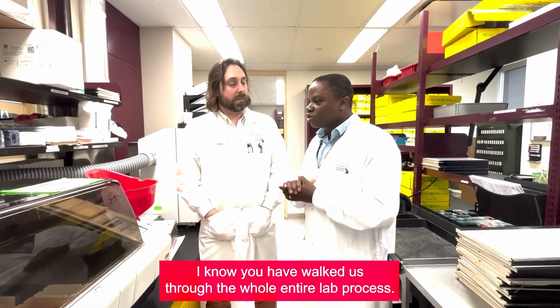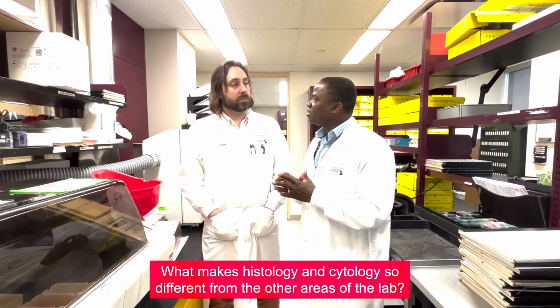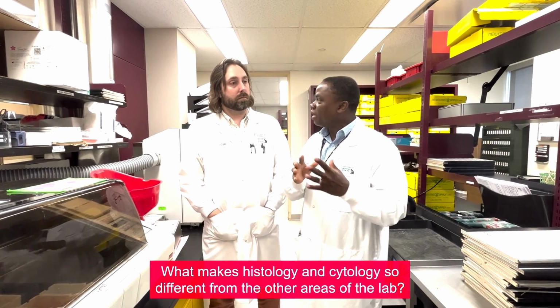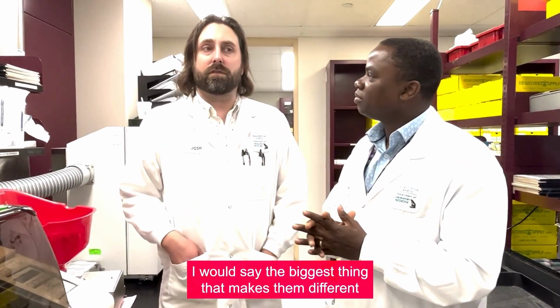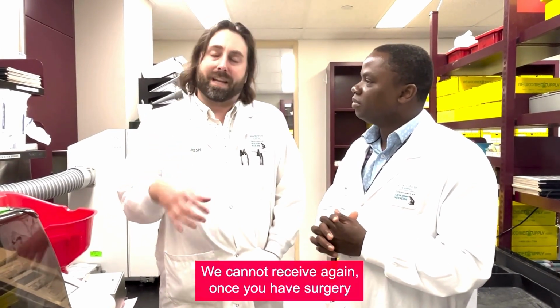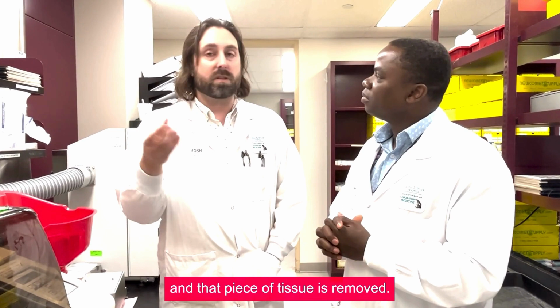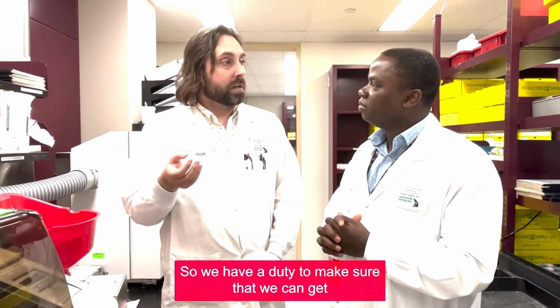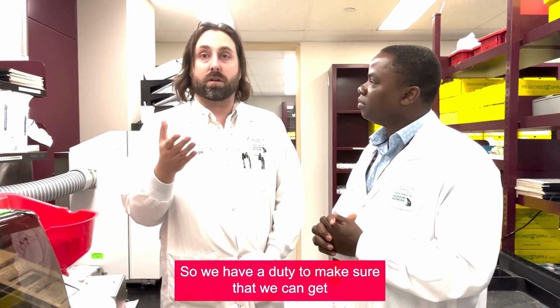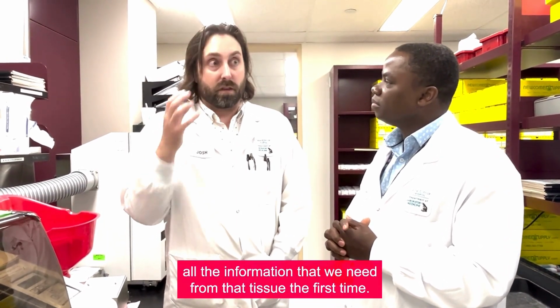I know you have walked us through the whole entire lab process. What makes histology and cytology so different from the other areas of the lab? I would say the biggest thing that makes them different is the specimens that we receive, we cannot receive again. Once you have surgery and that piece of tissue is removed, you can't go back and get more. It's already gone. So we have a duty to make sure that we can get all the information that we need from that tissue the first time.